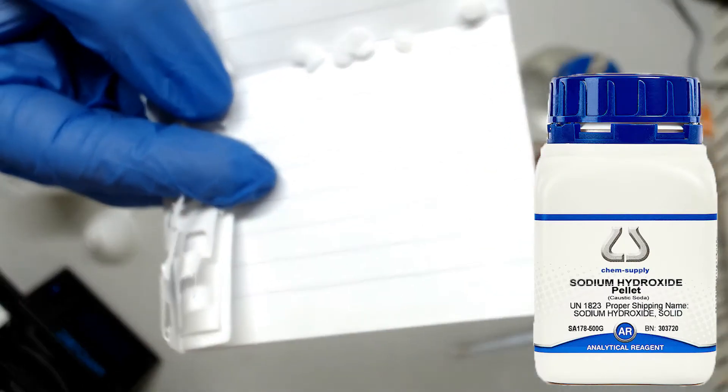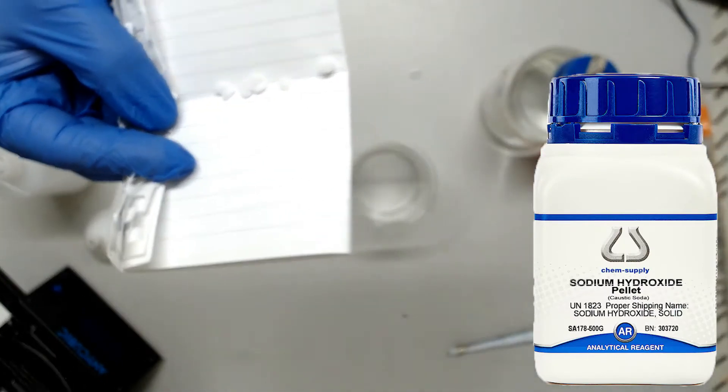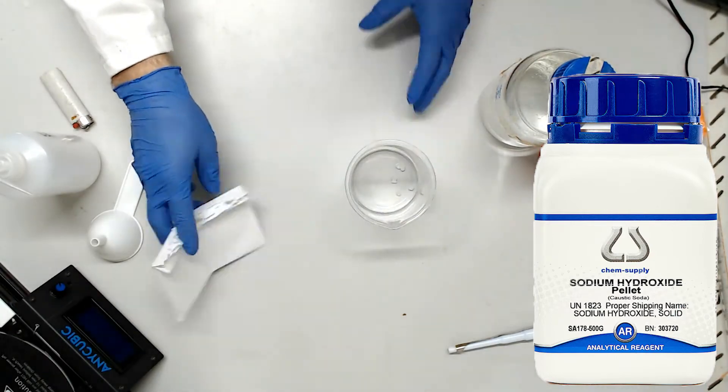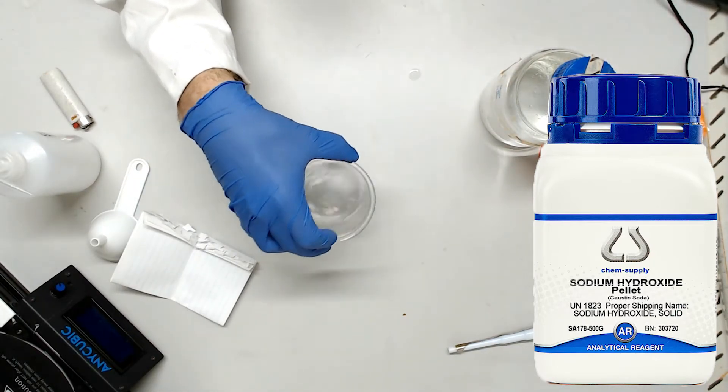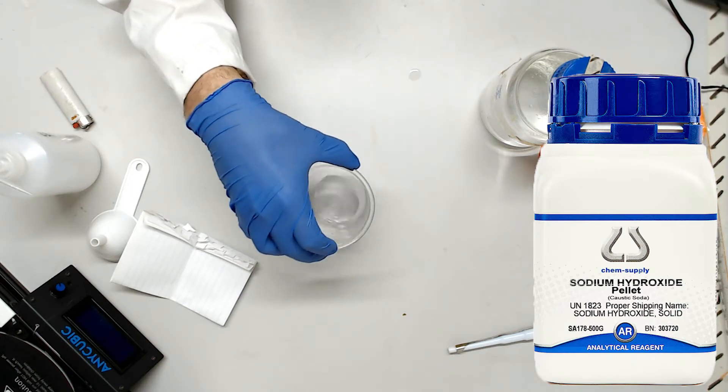In the demonstration we'll be using pellets of NaOH which is a far safer form and will prevent us from being exposed to any concentrated solution. At our desired concentration of 200 millimolar, sodium hydroxide will only be mildly irritative. Still, avoid skin and eye contact.